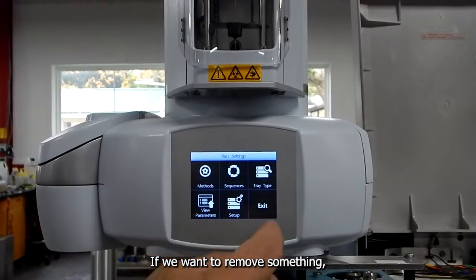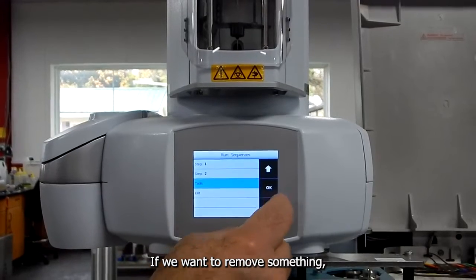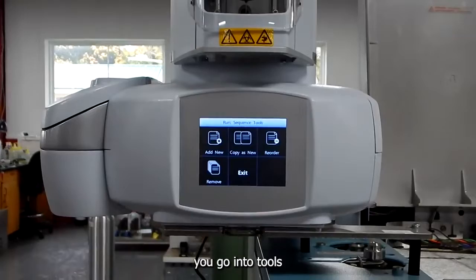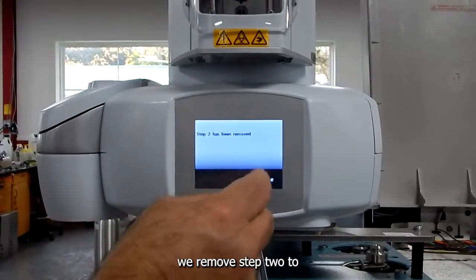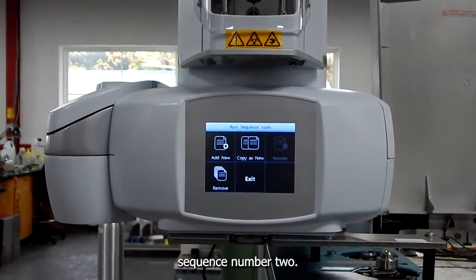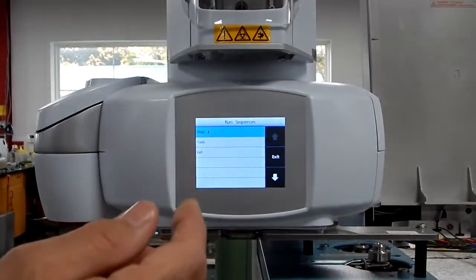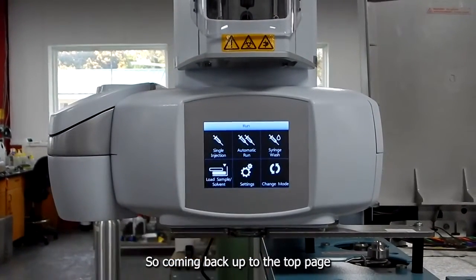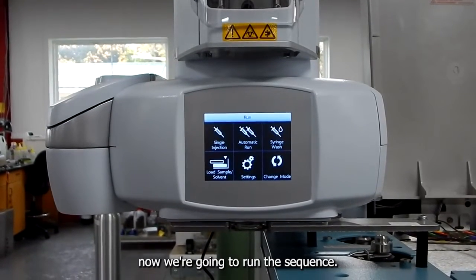And if we want to remove something, we'll go into Tools, and then we're going to remove. Now we remove step 2, sequence number 2. And so those are the sequence numbers for the different sequences. So coming back up to the top page, now we're going to run a sequence.